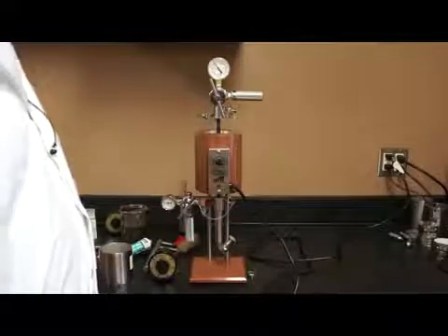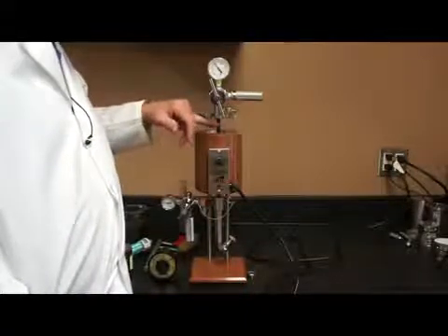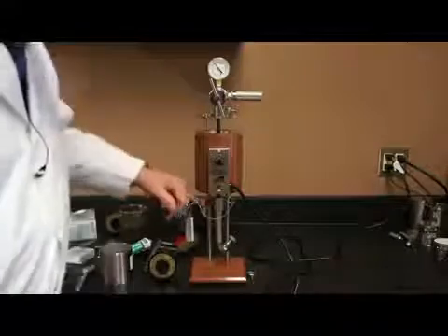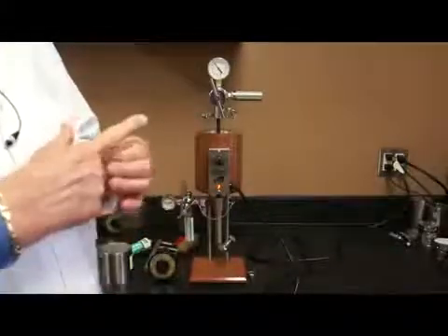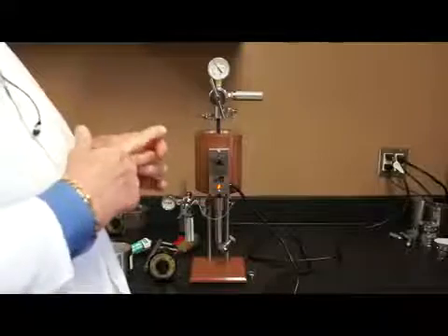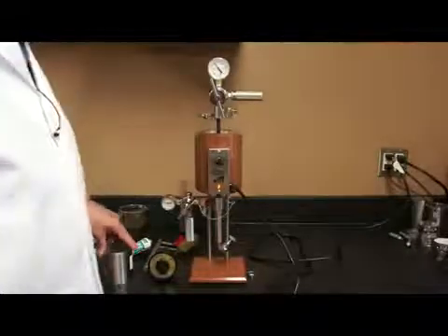However, I do still have pressure between the regulator and the cell and in the cell, as a matter of fact. So the pressure in the cell is sealed off by the valve stem, but I do have some pressure here and I've got some pressure between the regulator and the receiver body. So in order to alleviate that pressure, I open the safety bleeder valves. These safety bleeder valves have a dual function. They alleviate pressure at the end of the test, but they also prevent you from overpressurizing. They're preset to blow off at about 190 psi, which if you're using a full bottle pressure with nitrogen tank, you could put 3000 psi in there. So these are safety features.